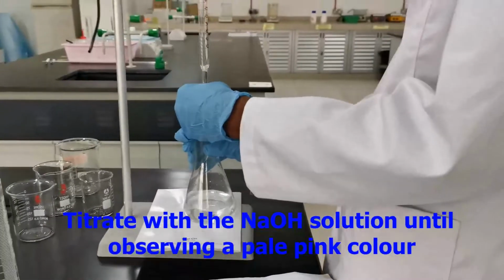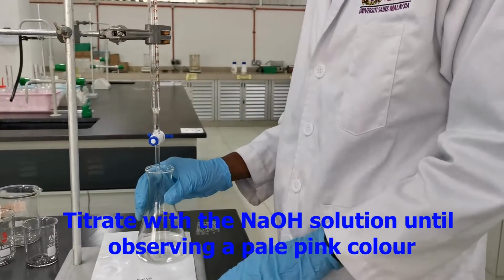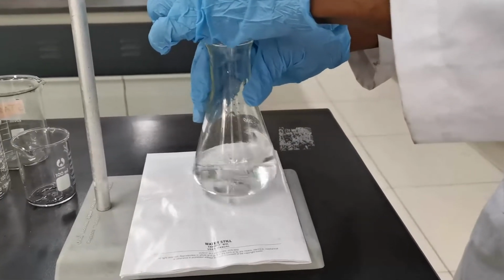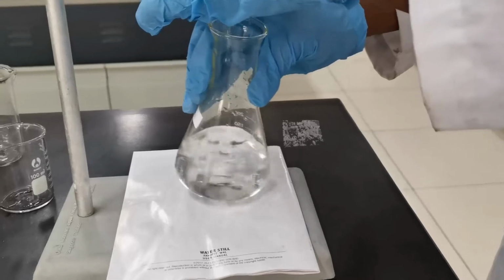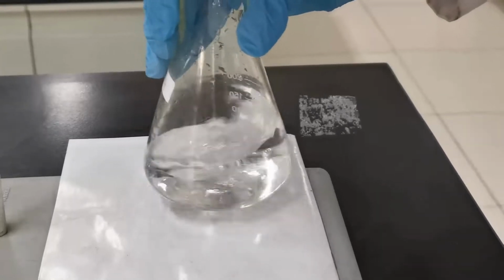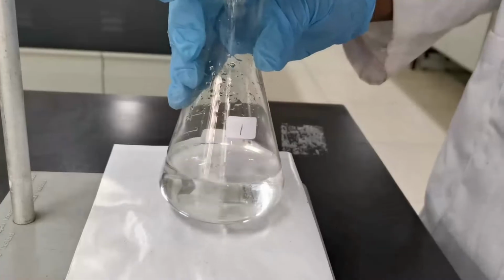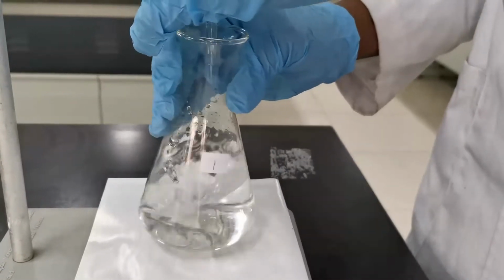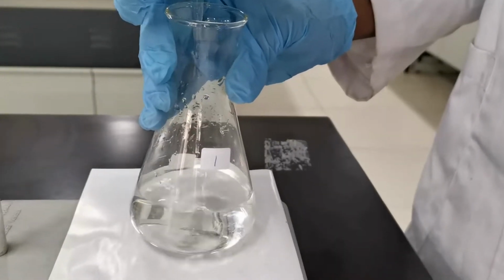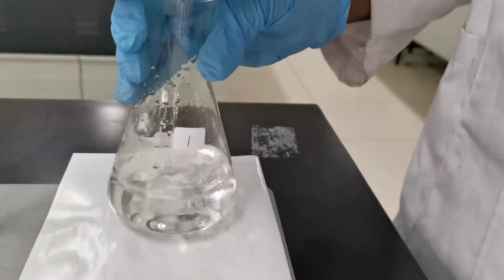Run gently until we observe a pale pink color. When you are running, be careful, don't run too fast. Make it slow, so that if there is any color change, you can easily stop. When you run, you swirl. You can see you're closer to the end point. That is why the color will disappear. You see that when the pale pink color is permanent, that's the end point.